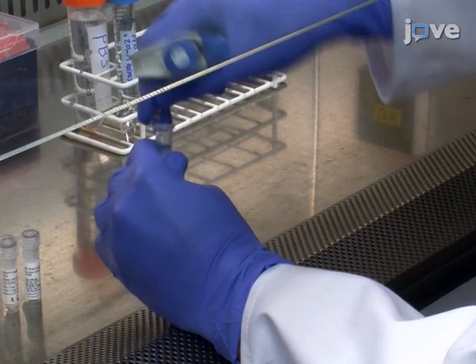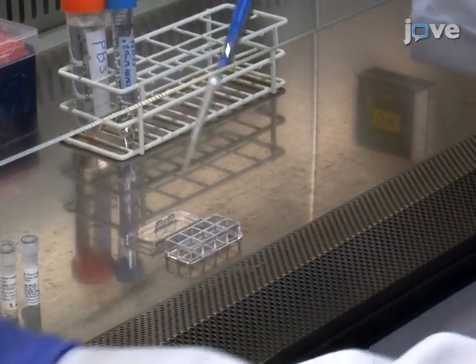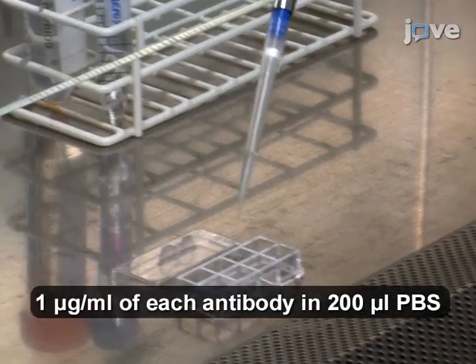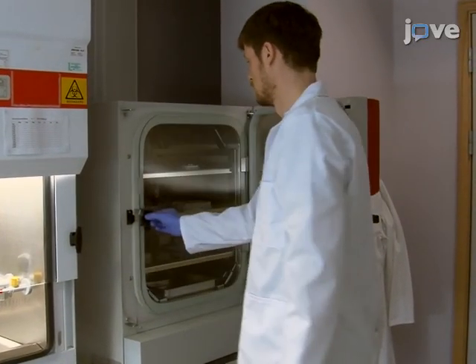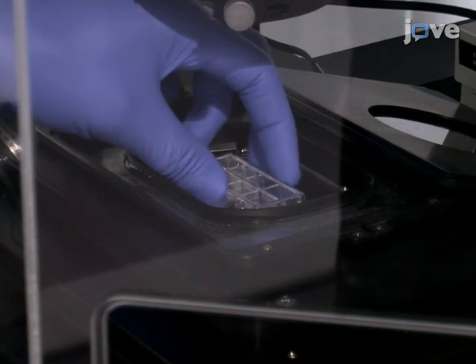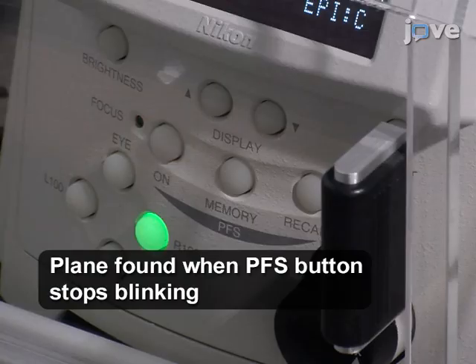For T-cell stimulation, coat the chambers of an 8-well cover slip with 200 microliters of anti-CD3 and anti-CD28 antibody mixture, and incubate the cover slip for 2 hours at 37 degrees Celsius. After washing the cover slip, as described in the text protocol, place it on the microscope stage, and then find the TIRF focal plane.